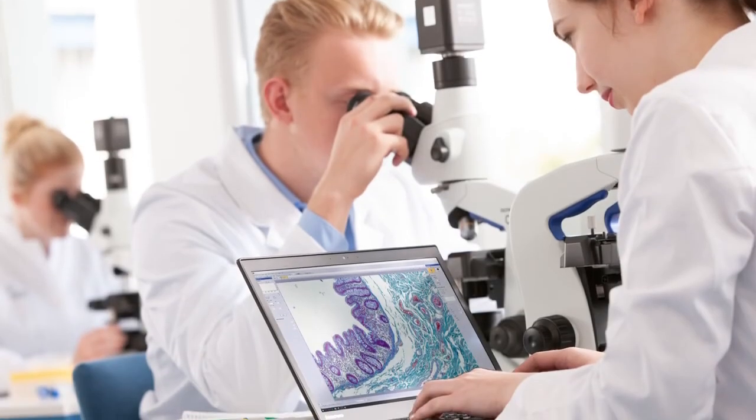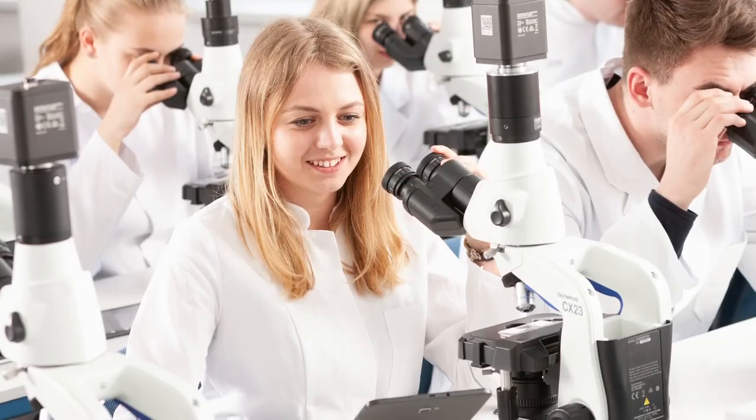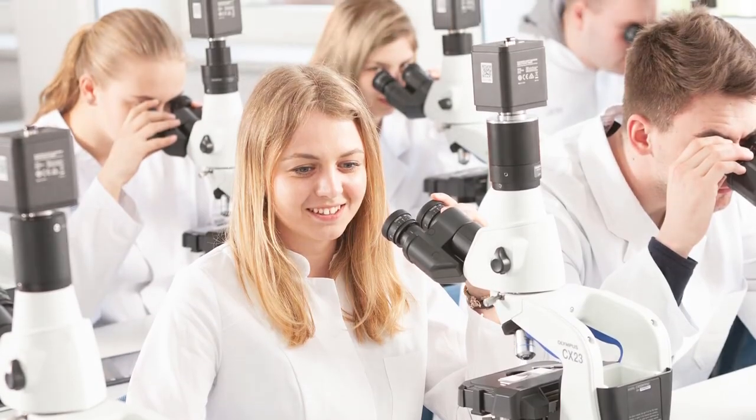Olympus EP50 digital camera — for engaging education in microscopy.